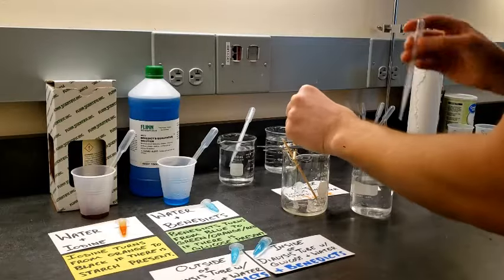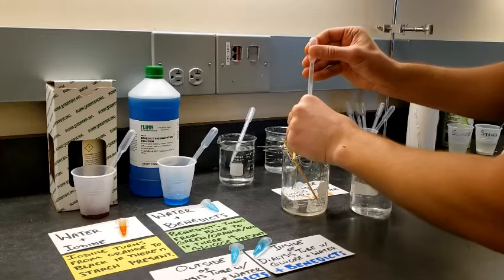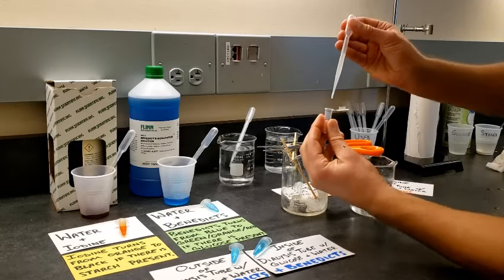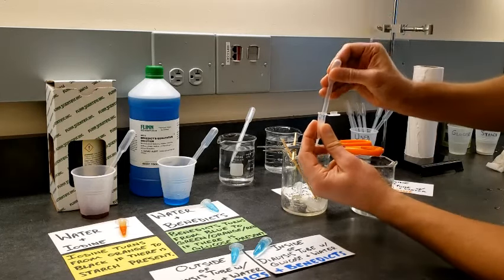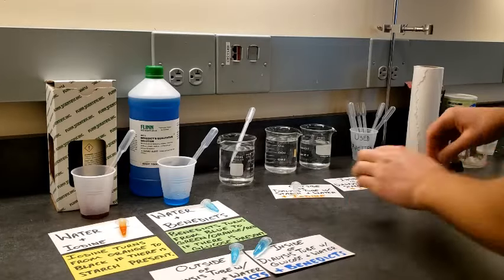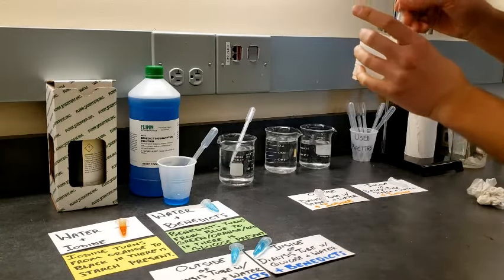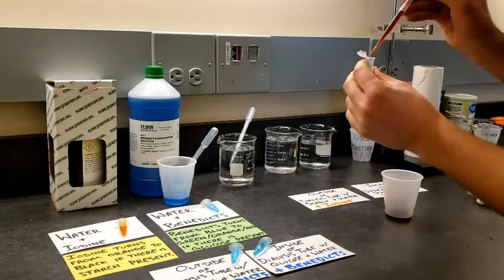I'm going to get my sample before I lose everything from the inside of the dialysis tube that had the starch and the water on the inside. I'm going to add it to another brand new microcentrifuge tube. Put my used pipette back. I'm going to cap this. That was a trip. Now I'm going to use some iodine, the indicator for starch, and we're going to see if there was any starch on the outside of the dialysis tube.